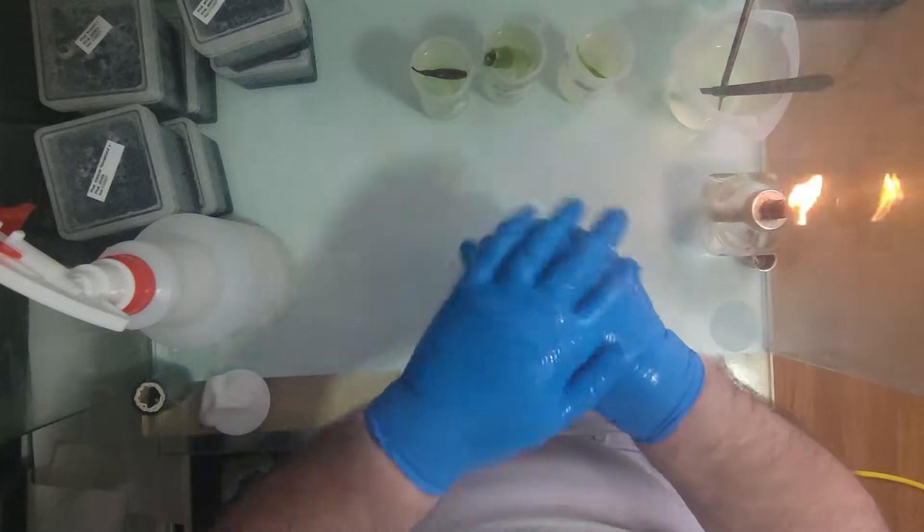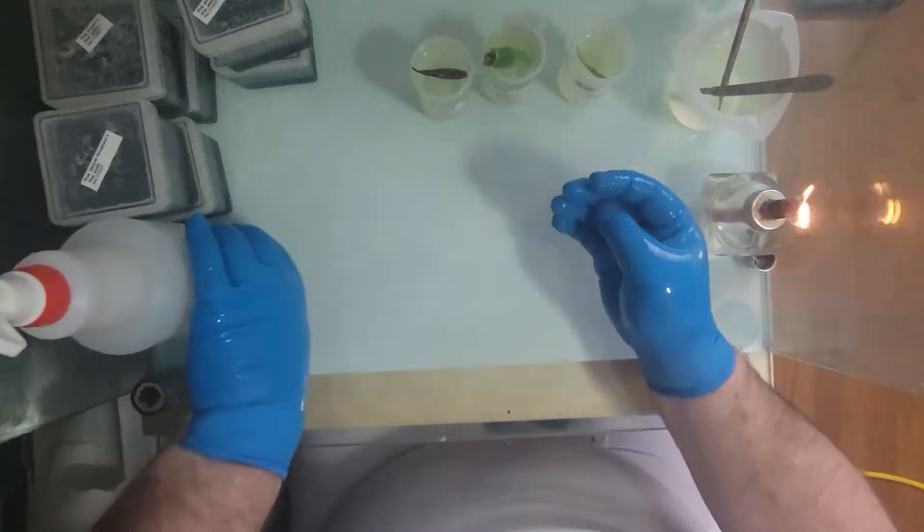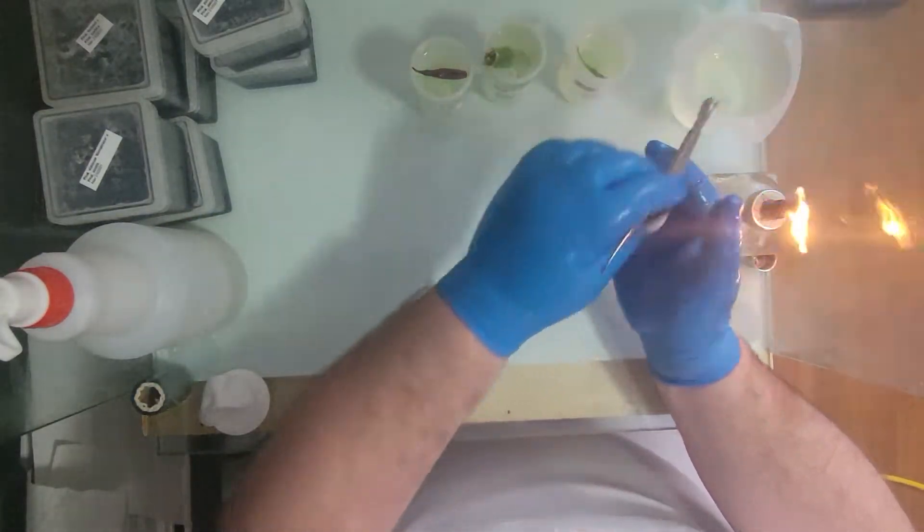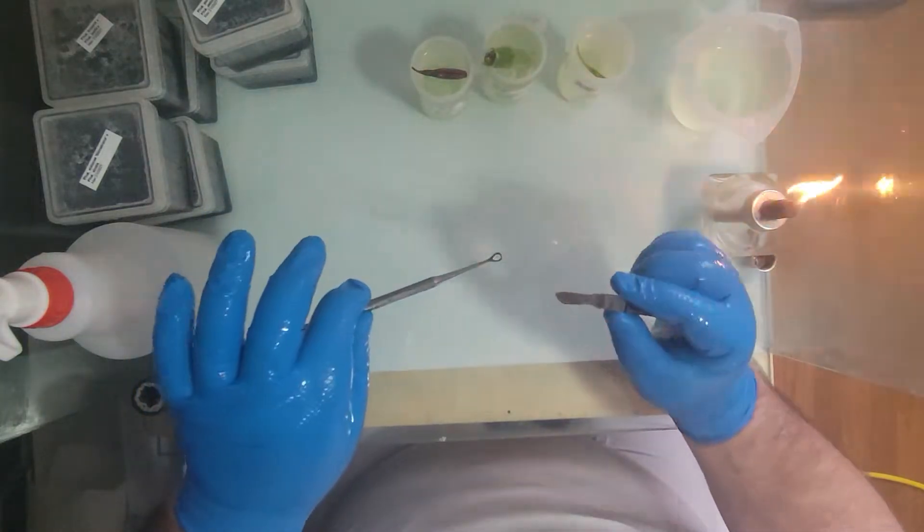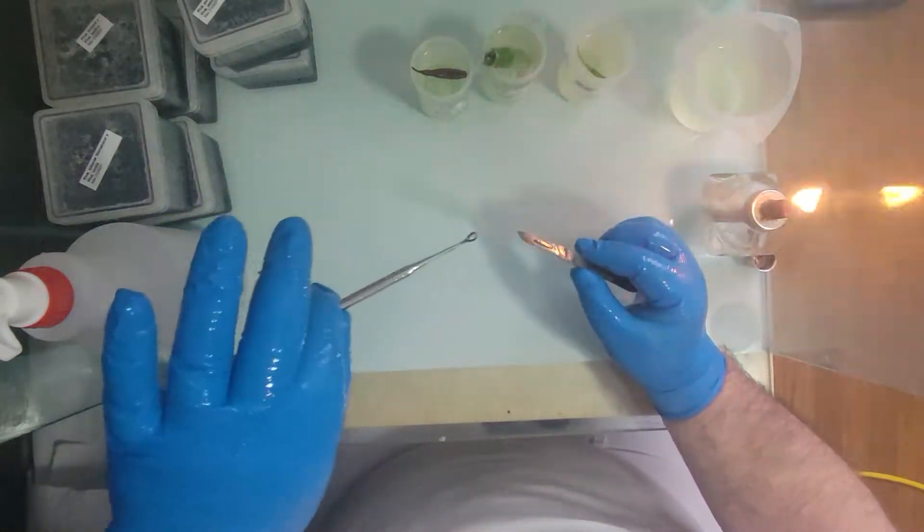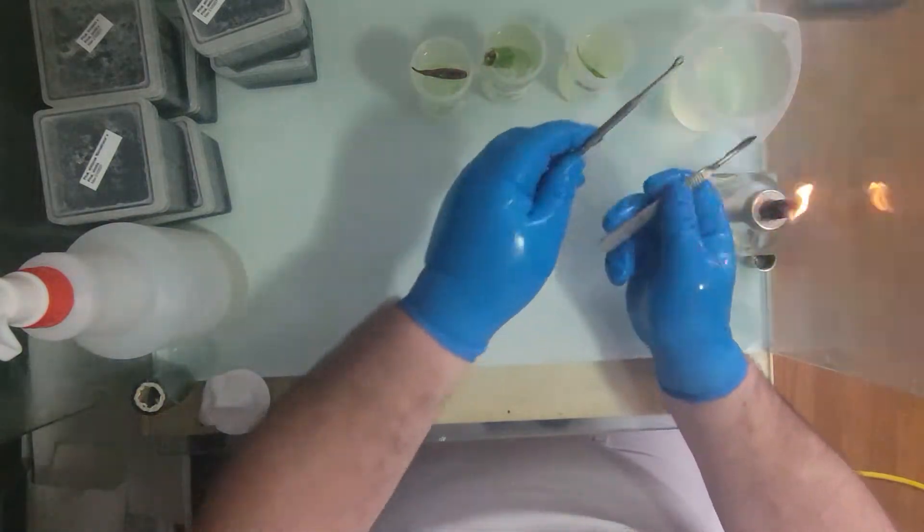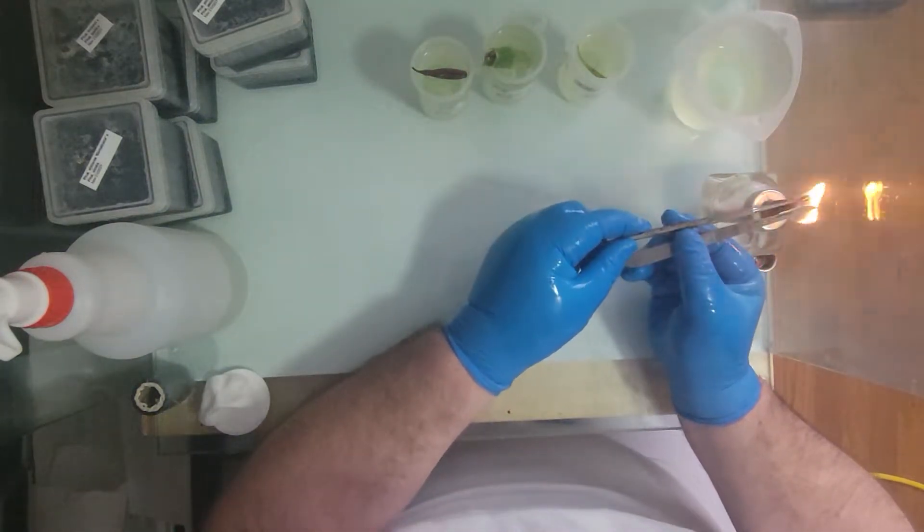Make sure it's very nice and full of bleach. So we have an X-Acto and we have a spoon scraper, essentially able to scrape out seeds from the seed pod. So I'm going to heat those first.